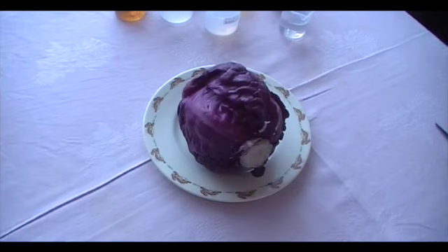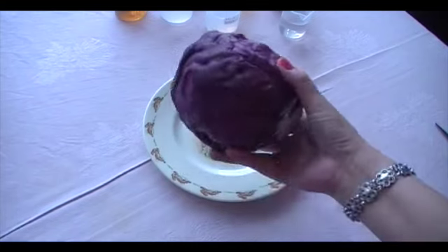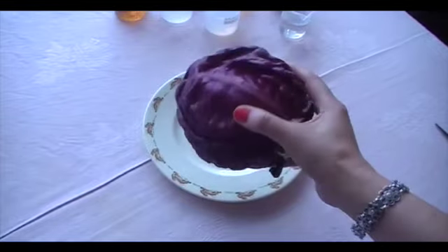And just now we have learned that we can decide whether a solution is acidic or alkaline using universal indicator paper. But we also can use self-made indicators. Now, red cabbage is a good indicator we can use.